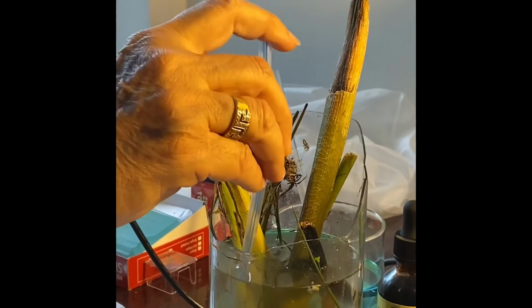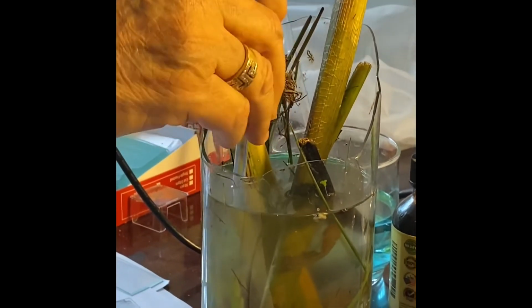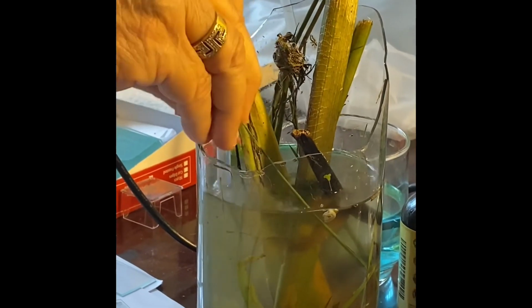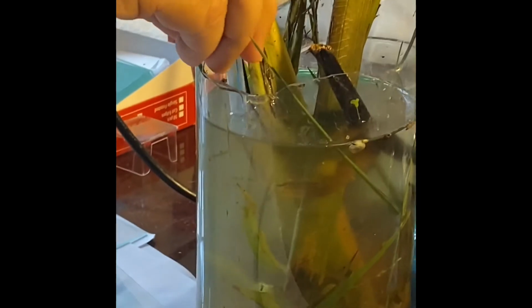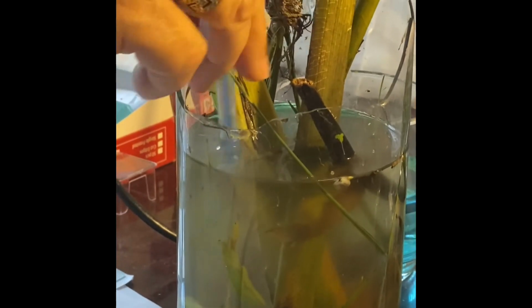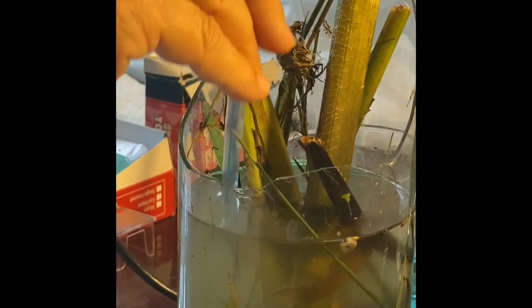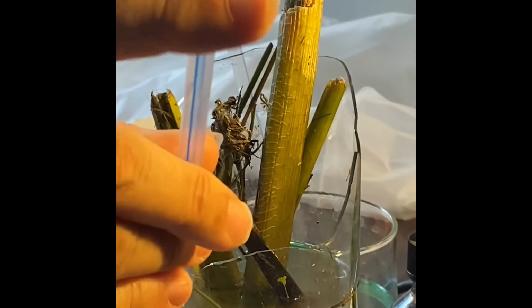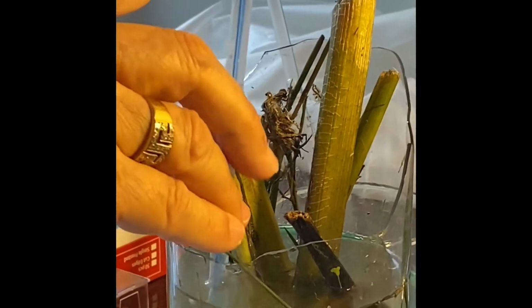It can reach down into the pond water, and you can stir it up and agitate some of the dirt that might be there among the plant life. Then you see how you can control the drops that come out of this.